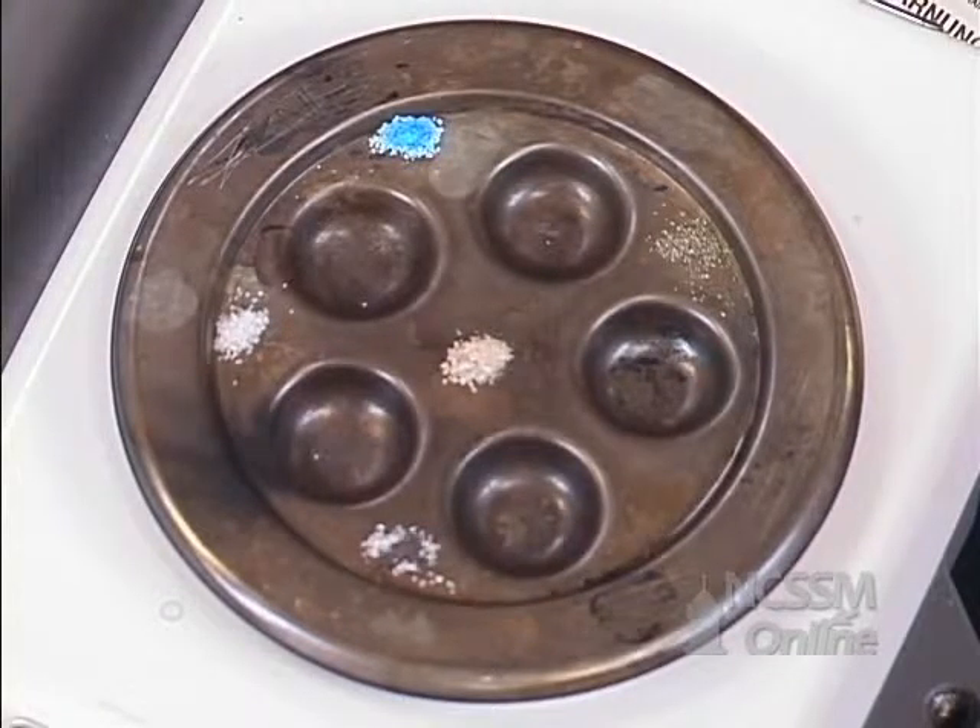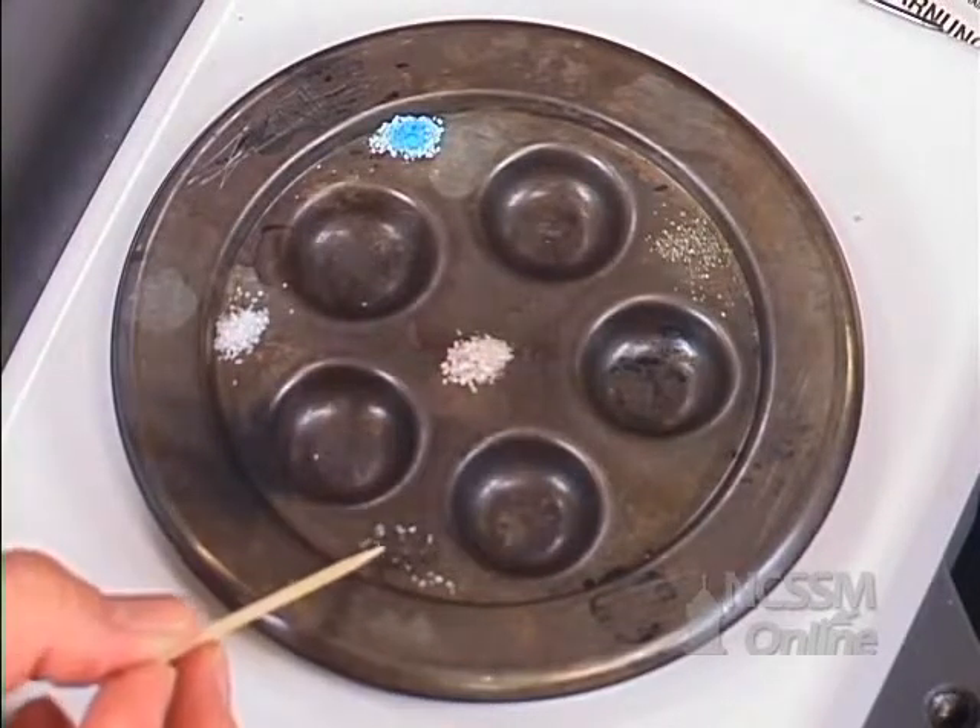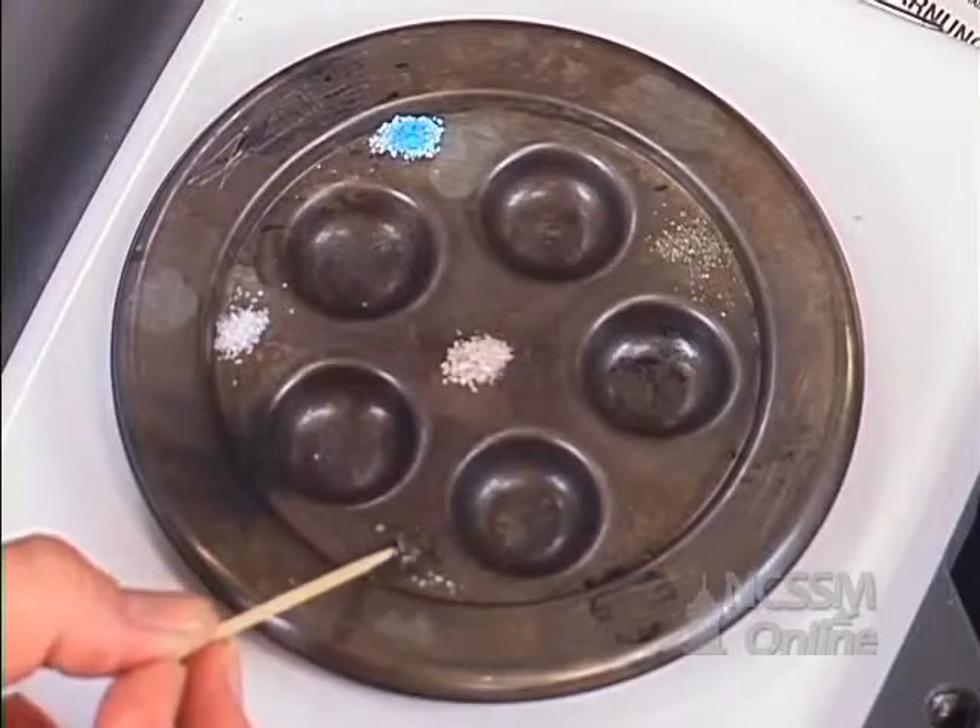Something that's happening to the sucrose. Do you see the smoke coming off the sucrose? Same conditions.